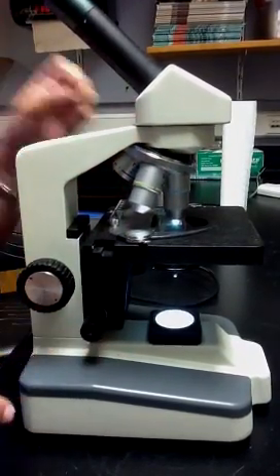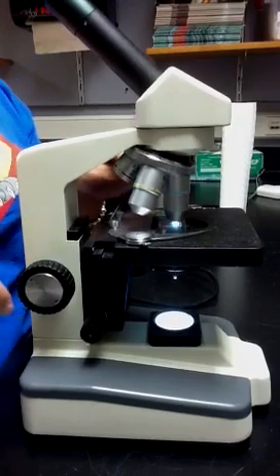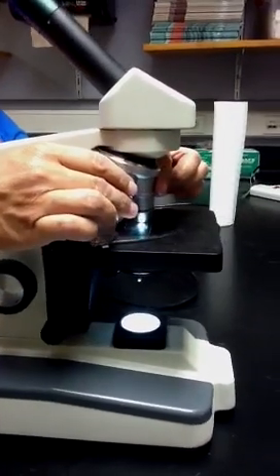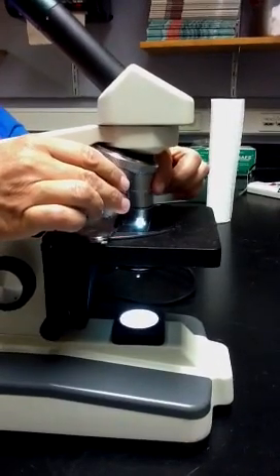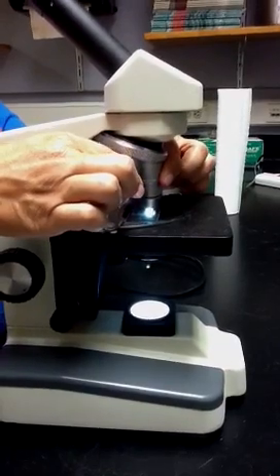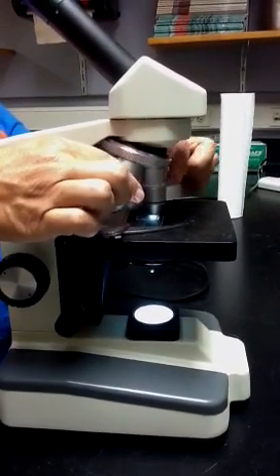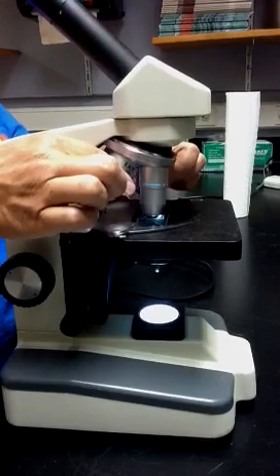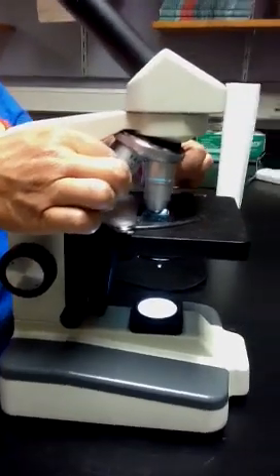And you really should never go to 100x, never use the highest power because it sometimes hits and cracks the cover slip, the glass cover slip. So this objective lens should only be used if I give you permission to use it. Okay. Thank you.